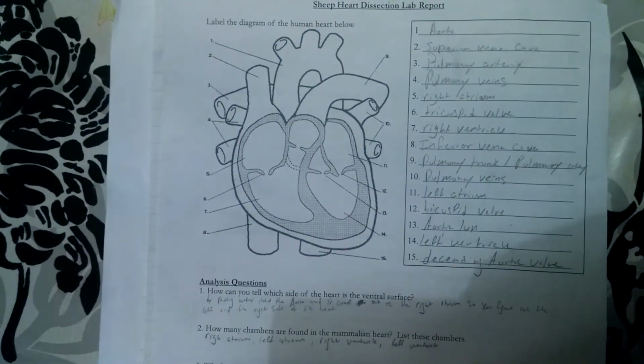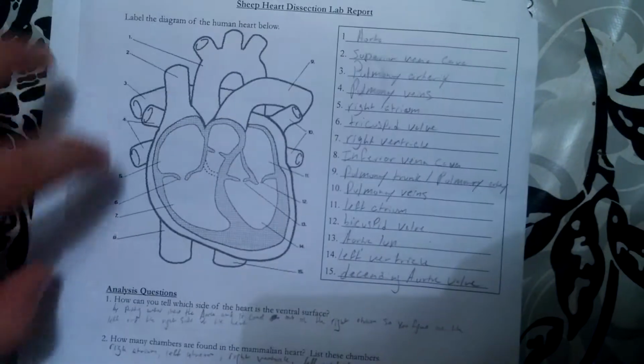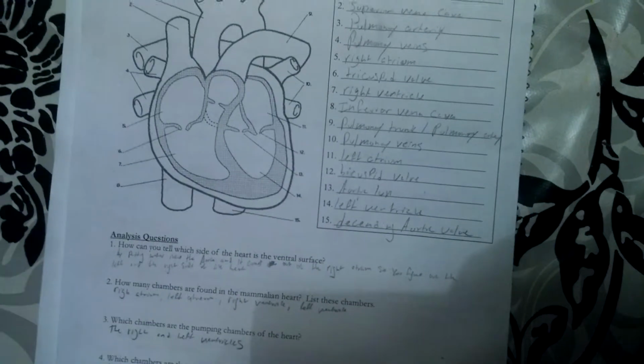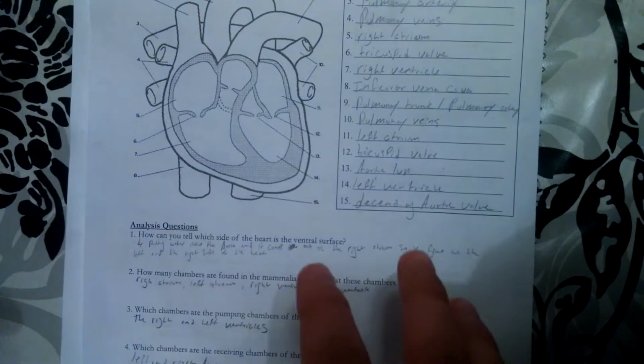And as a reminder, Heaven was the one that was in my group, and she was the recorder throughout the entire dissection. She recorded everything that I told her. While I was doing the dissection, she would tell me the questions that needed to be answered. She helped me out with moving the papers to see exactly which questions needed to be answered and what I needed to do.